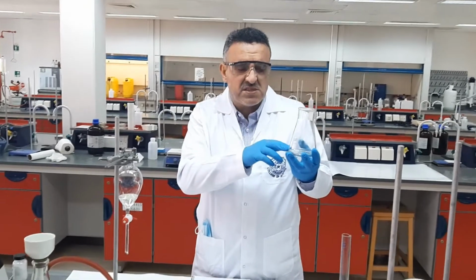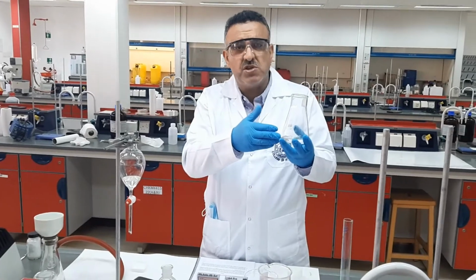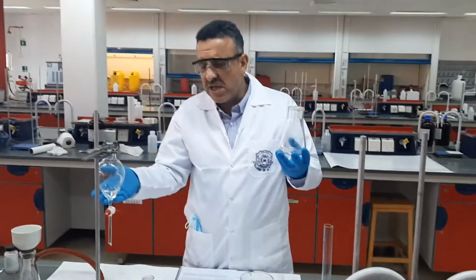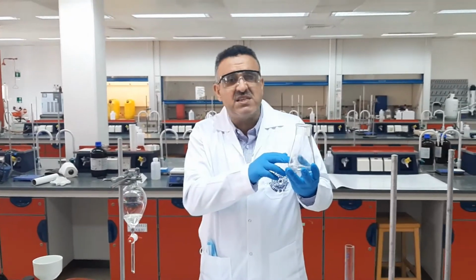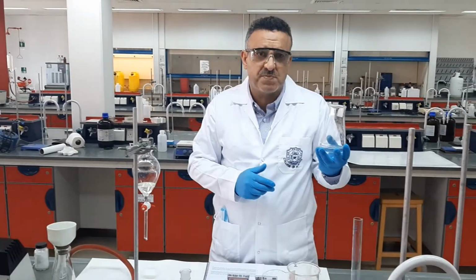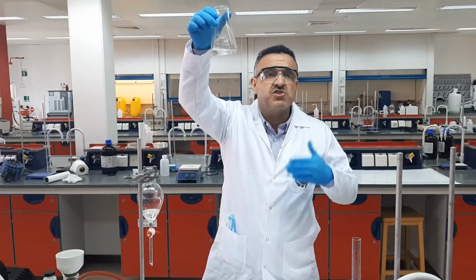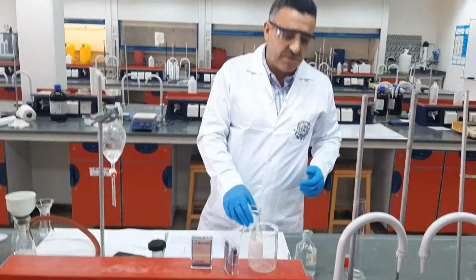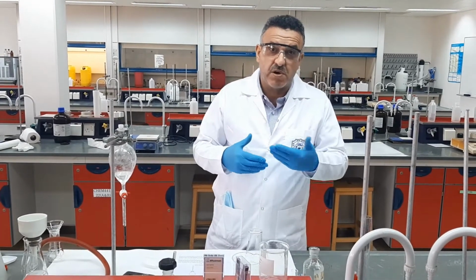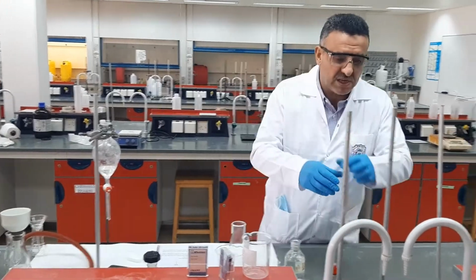Now, of course, as we know, an acid reacts with a base, and therefore we should expect the benzoic acid, which was within the organic layer, to have reacted with the base, the sodium hydroxide, and been converted into its corresponding salt. So we have the benzoic acid salt, soluble, dissolved in the water as a salt, because the water contains base.